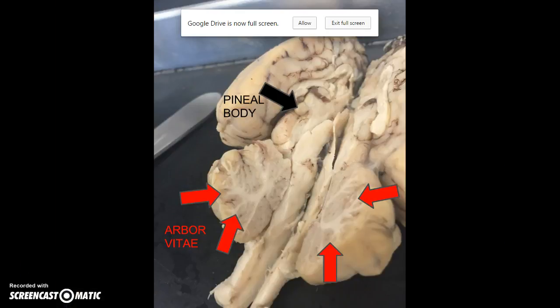In this last image, the brain is split along the medial longitudinal fissure, showing a sagittal view of both hemispheres of the sheep brain. The arbor vitae are the tree-like patterns inside the cerebellum, and the pineal body is an endocrine gland, which secretes melatonin.